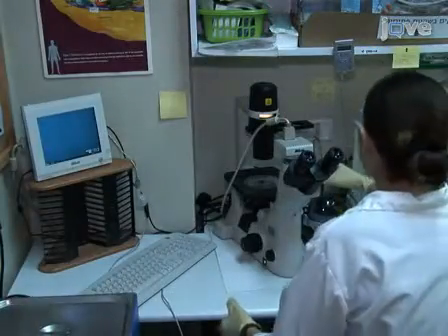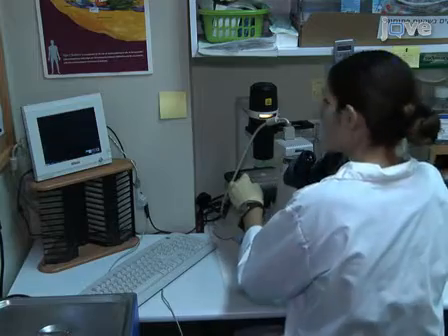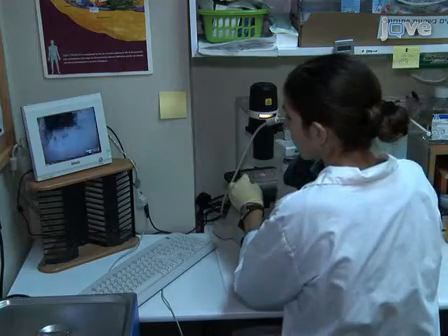During this incubation period, examine the plate under the microscope and look for vessels sprouting from the aorta, and for advanced mature vessels identified by further branching. Vessels should extend from the ring tissue three-dimensionally. Photograph the rings between day 6 and 12 under standard phase contrast stereoscope.